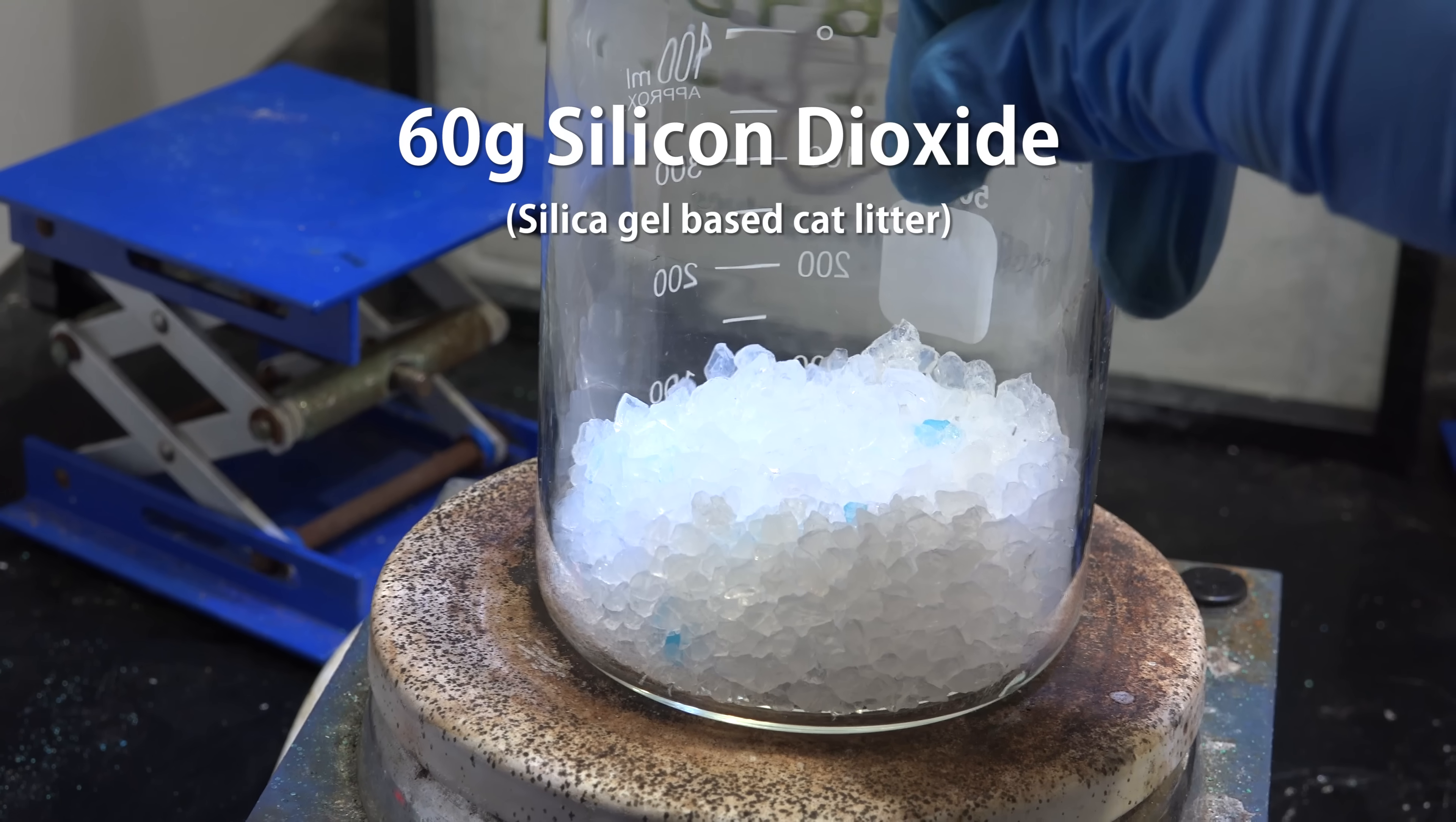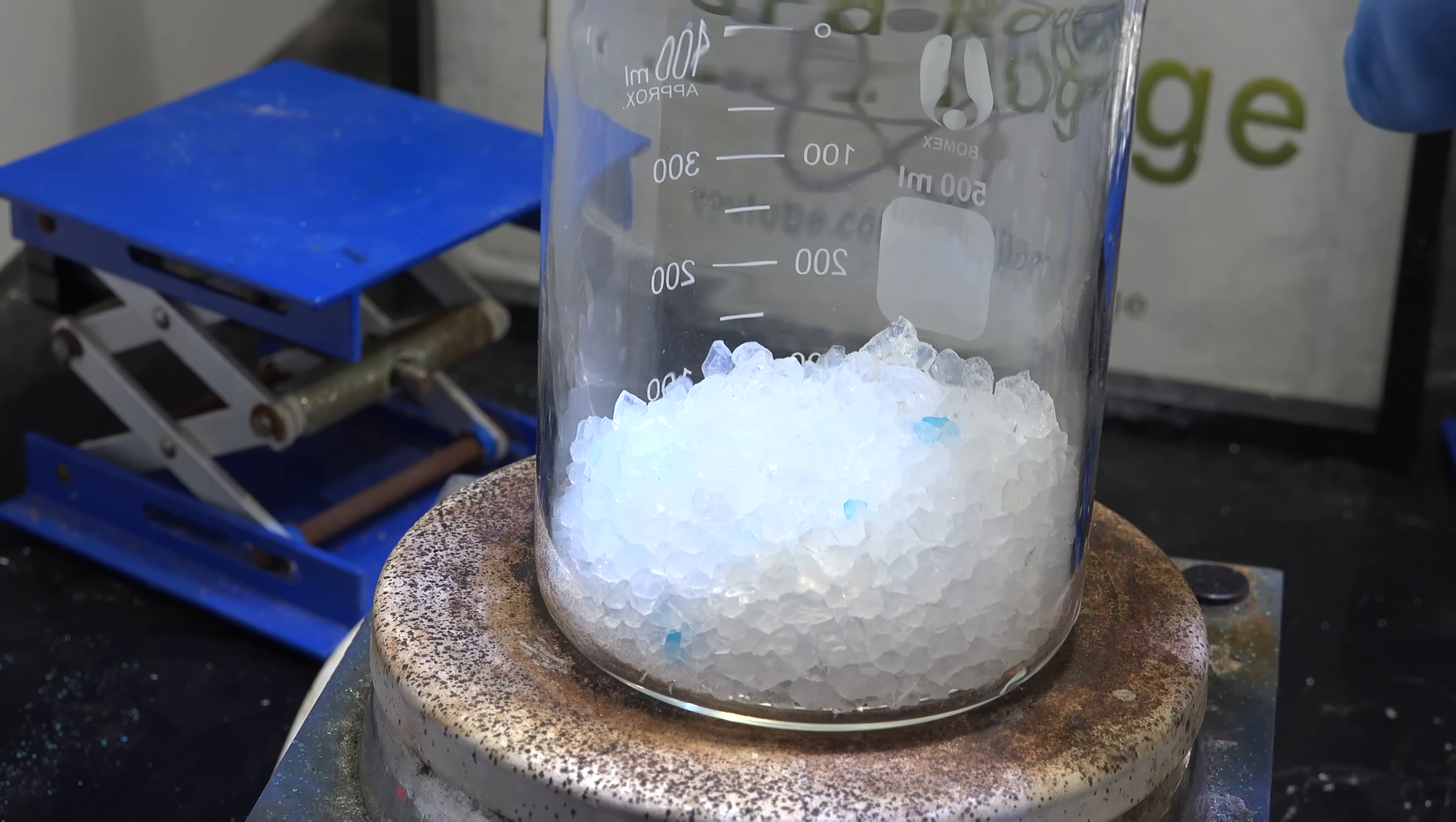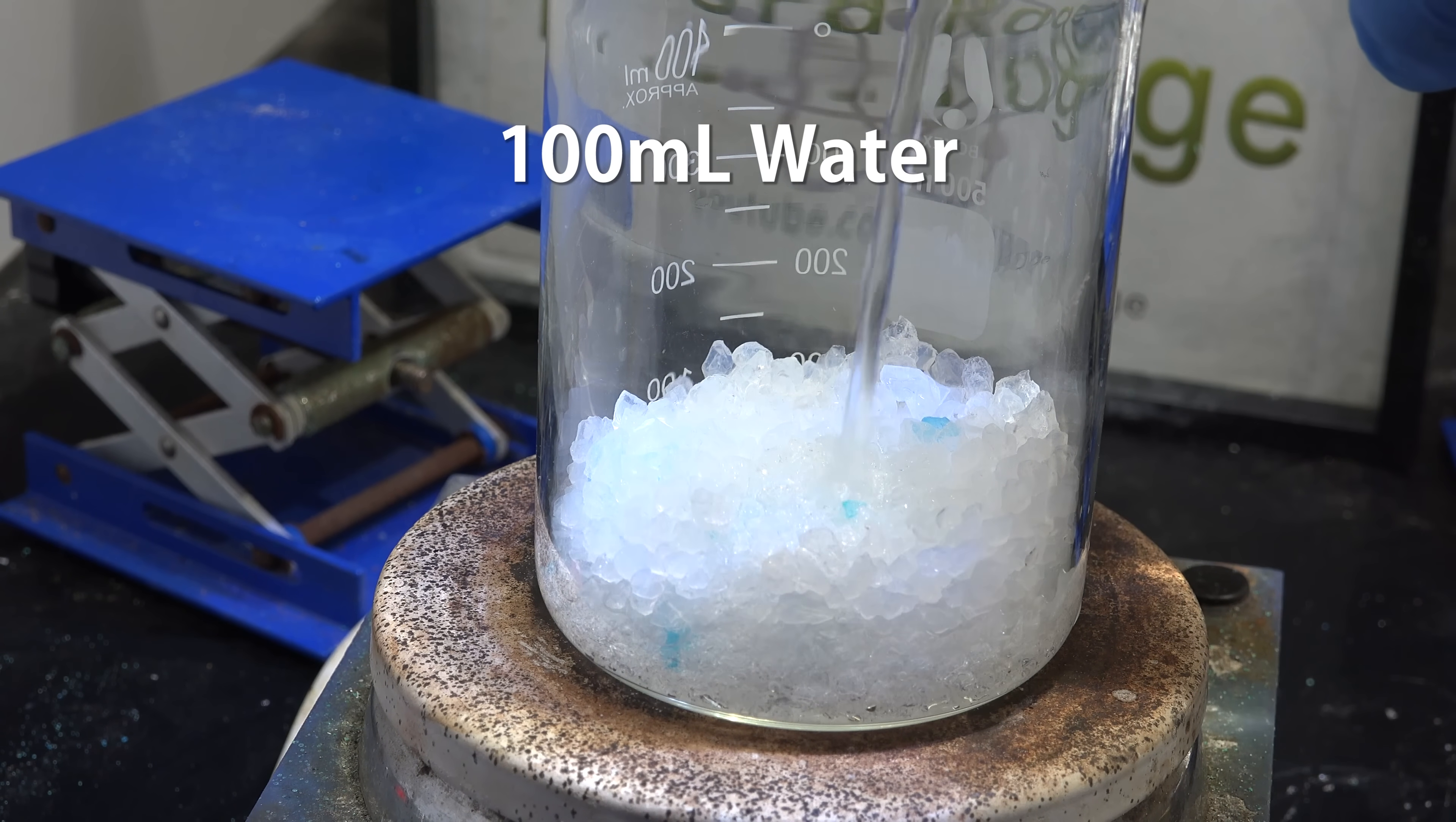I strongly recommend using new cat litter. You can use previously used cat litter if you desire, but I feel that would be a bad idea. Anyway, to this we add 100 milliliters of water.